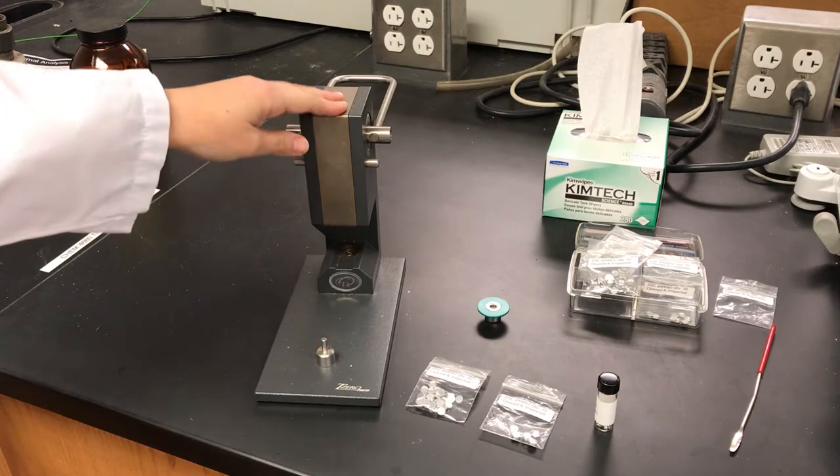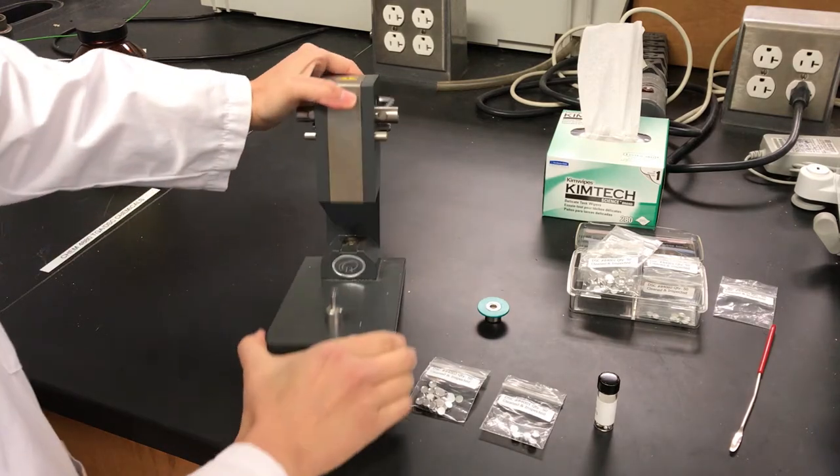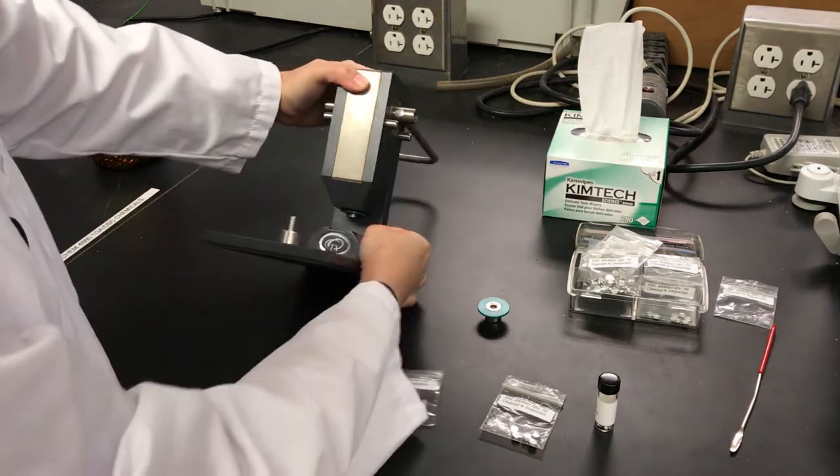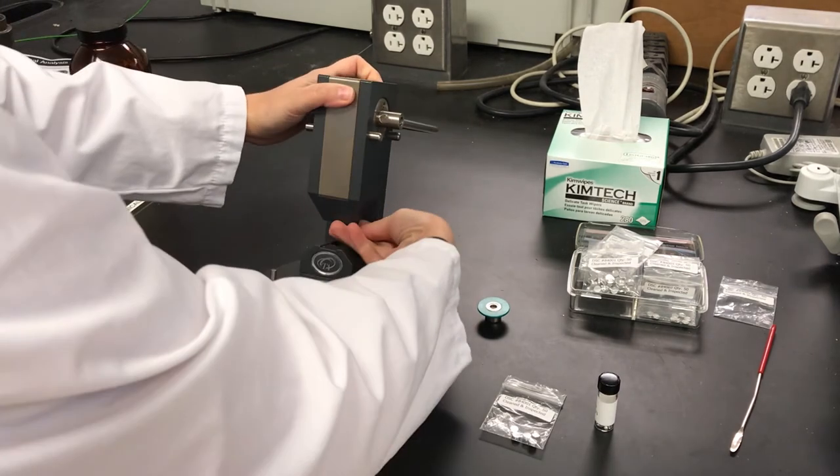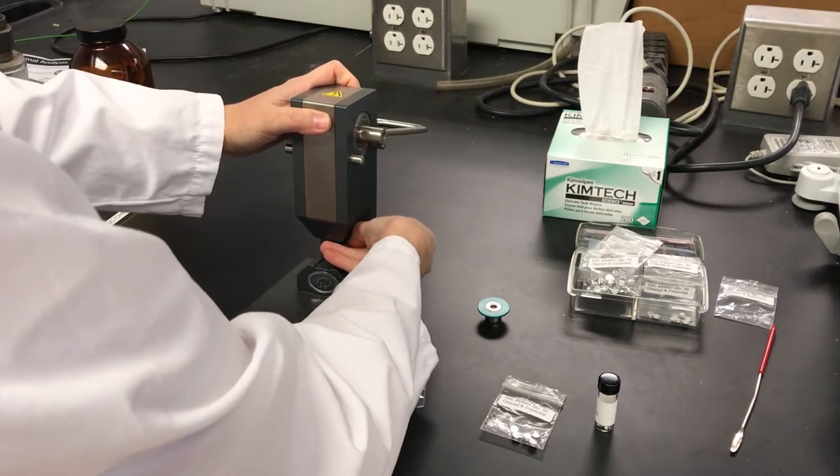We use this sample press here. Take a look at it. There's a die set inside of the press. Pull this out.